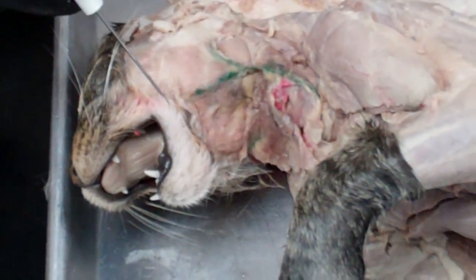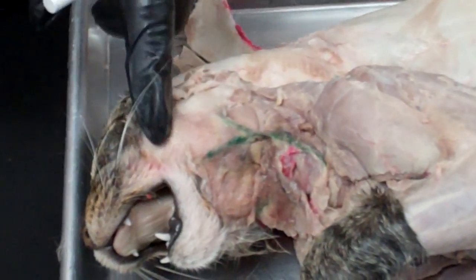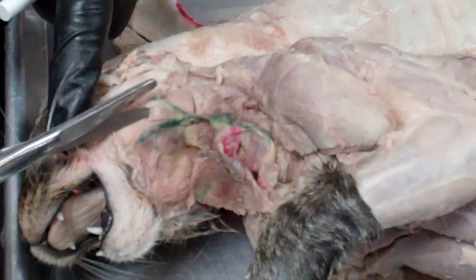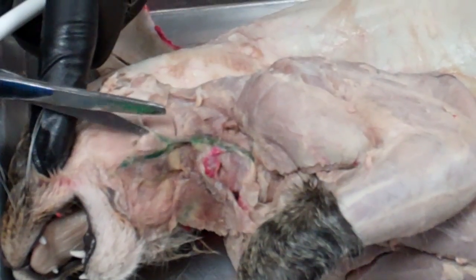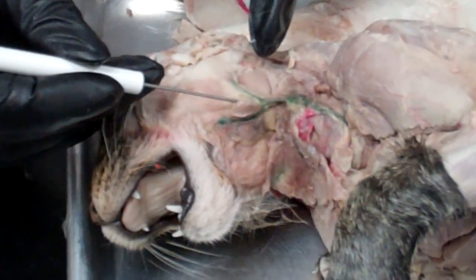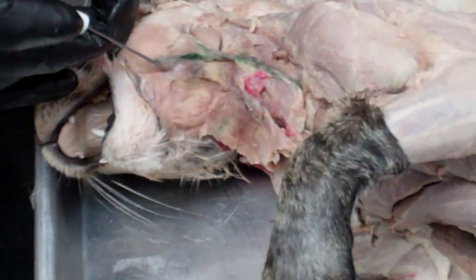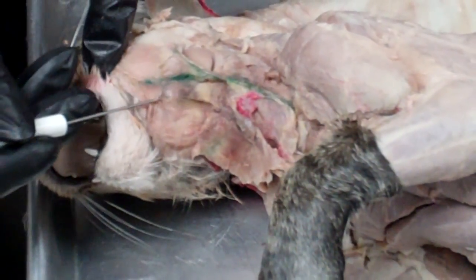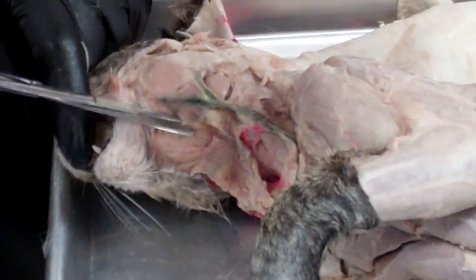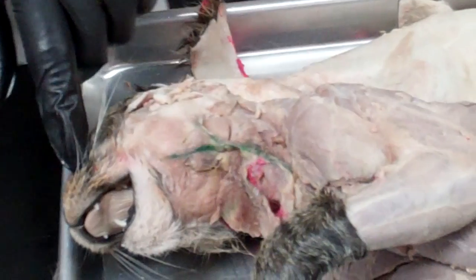The last thing to find in the cheek area is the lymph nodes. Cats tend to have a lot of lymph nodes because they are not careful about what they eat and need them to deal with bacteria. Go through some of the connective tissue here — this is one lymph node right here, and there's one on the other side. Free them up a little but don't remove them, as they are good markers for where you find the anterior facial vein.